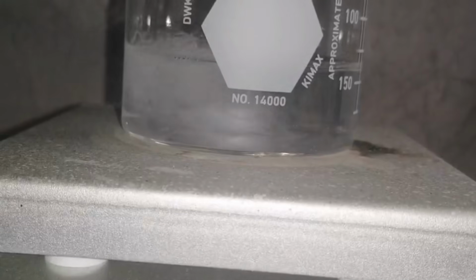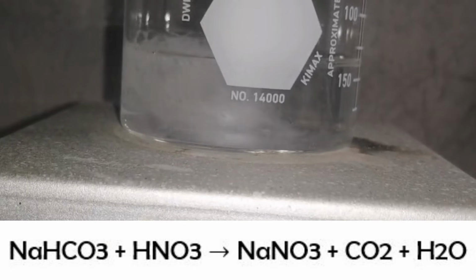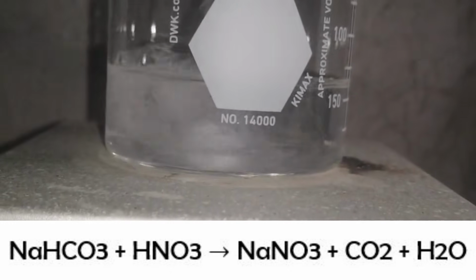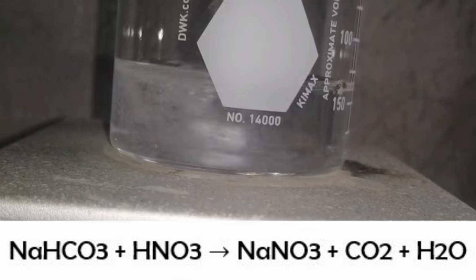The chemical reaction happening here is as follows. 1 mole of sodium bicarbonate reacts with 1 mole of nitric acid to form 1 mole of sodium nitrate, 1 mole of carbon dioxide, and 1 mole of water.